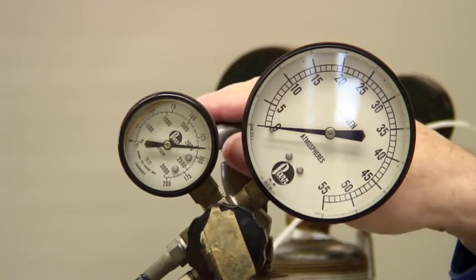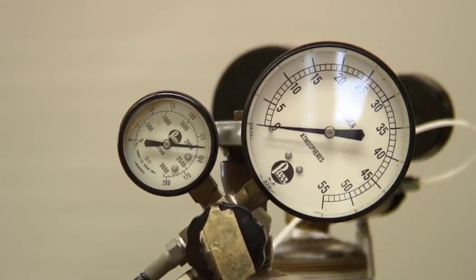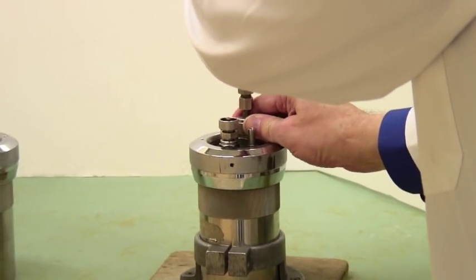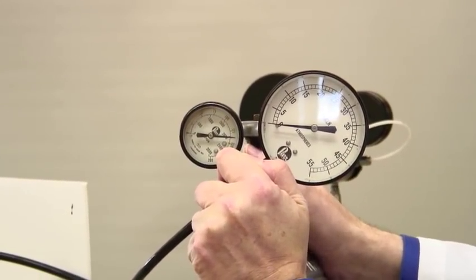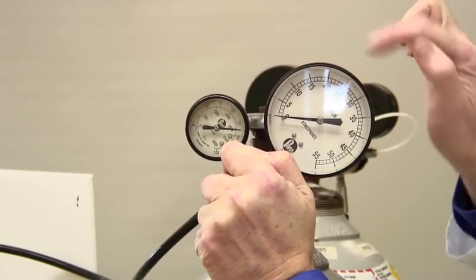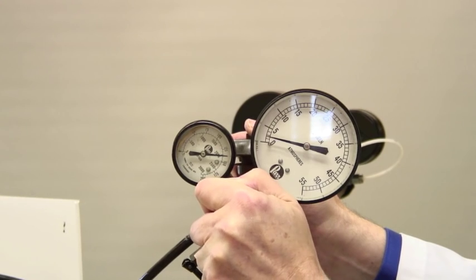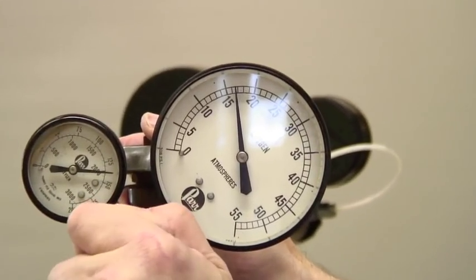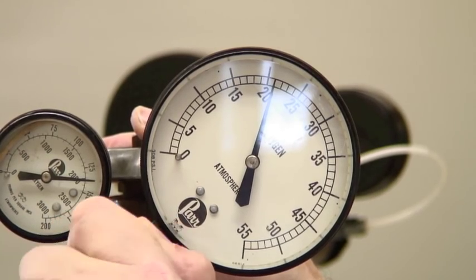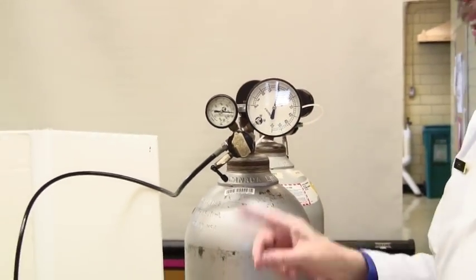This larger dial is what is happening from here down to the end of this tube. The tube attaches onto the threaded inlet, and again it's finger tight. And I use this handle here to allow oxygen into the bomb. You'll see this pressure engage. You may actually hear some clicking noises, which is the valve starting to work. By letting it in in small amounts, I'm not letting it go too far. What I want is 20 atmospheres, which this has now.